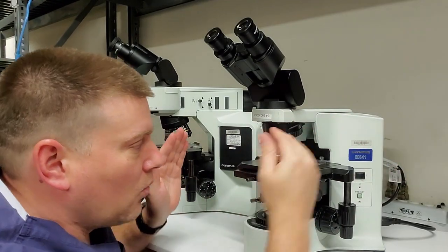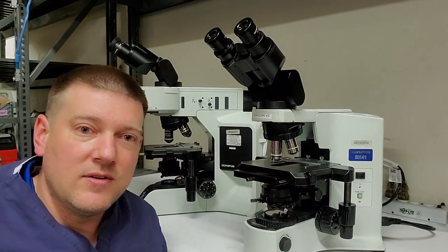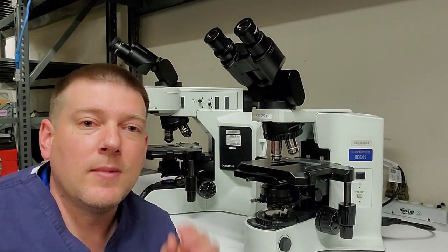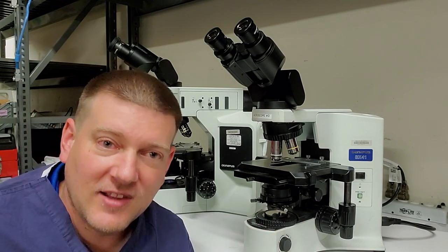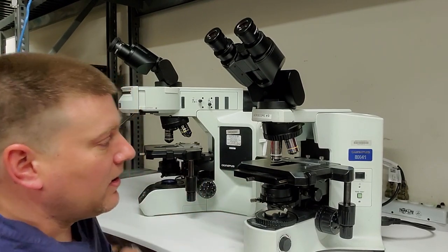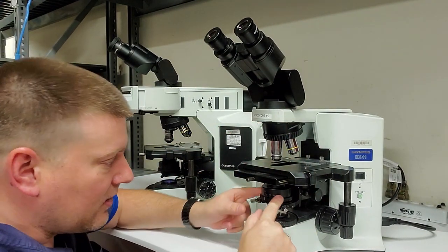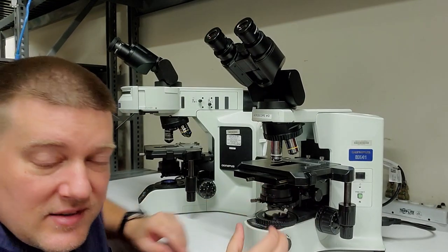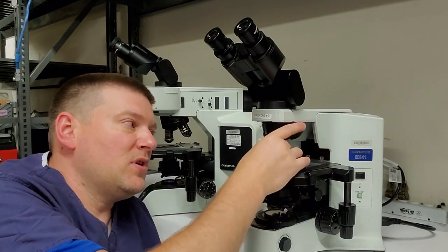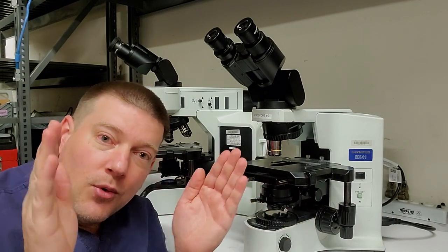Well, when you increase your magnification, you are changing the height. And when you are making your aperture smaller and smaller and smaller because you're increasing your magnification, well, you're going to have less light coming in to your objective. So it's going to get darker and darker and darker as you increase your magnification. So how do you compensate for that? Well, right here you have your condenser, and you can adjust your condenser to compensate for your magnification ratio. So if you flip between your objectives and the sample gets darker, well, that's simple. You just adjust down here, you refocus the light.